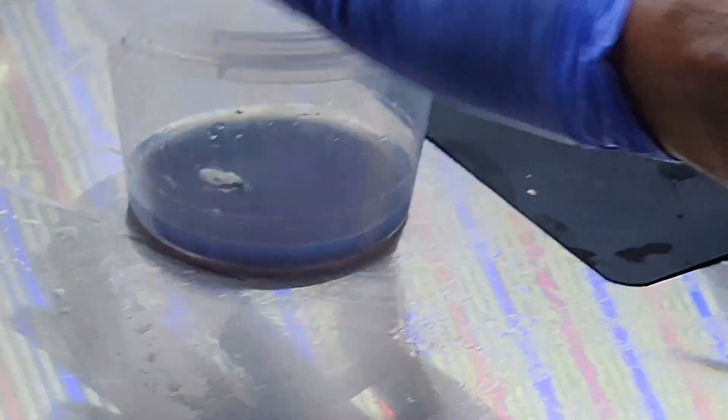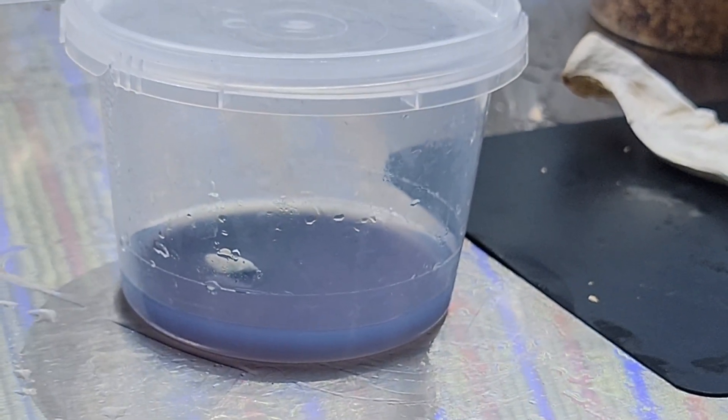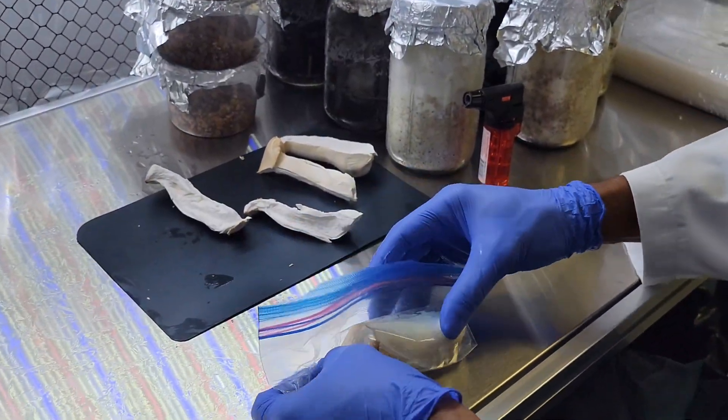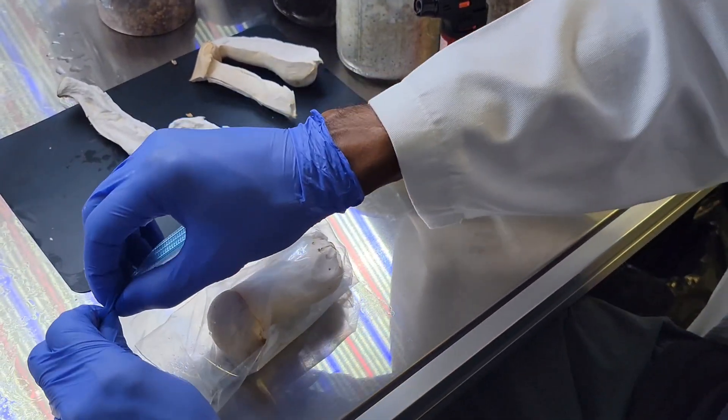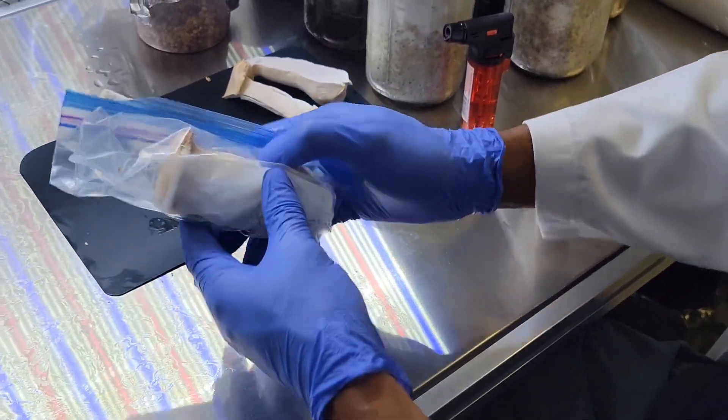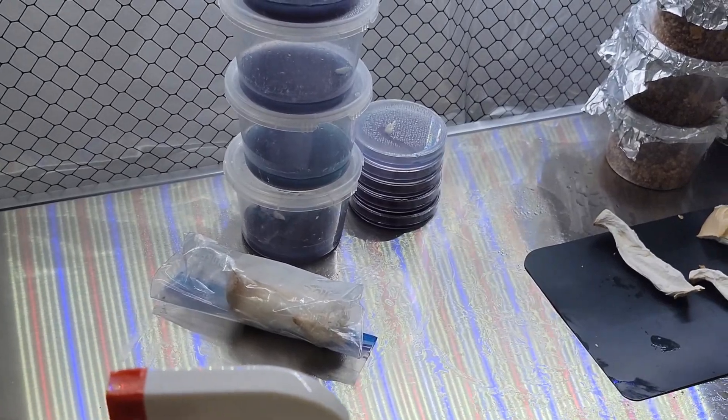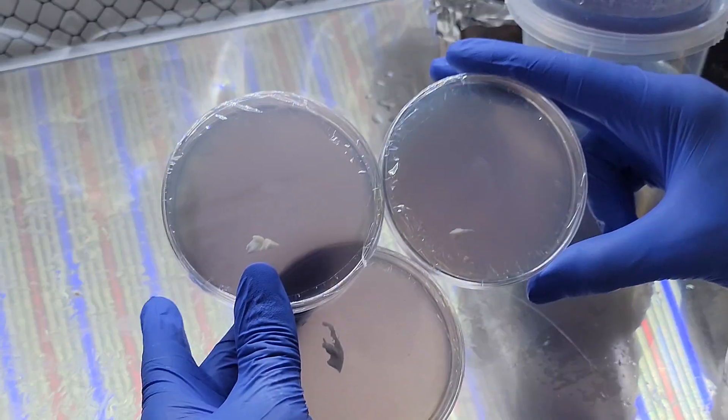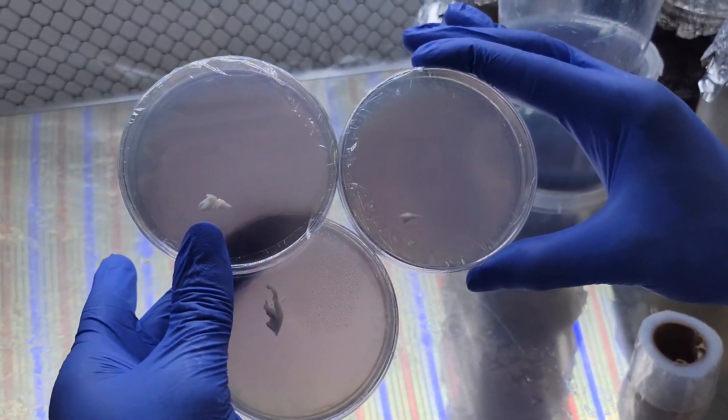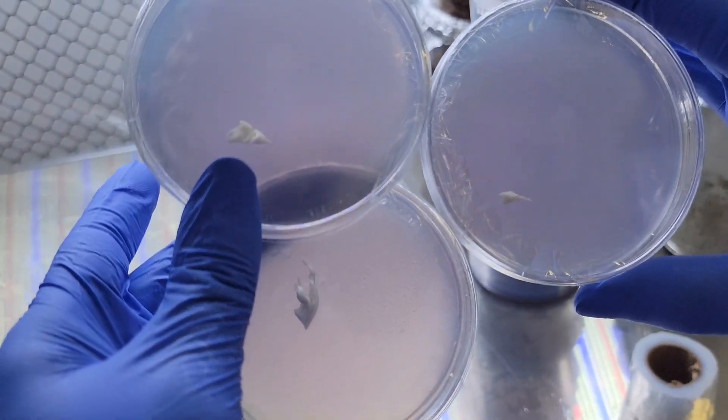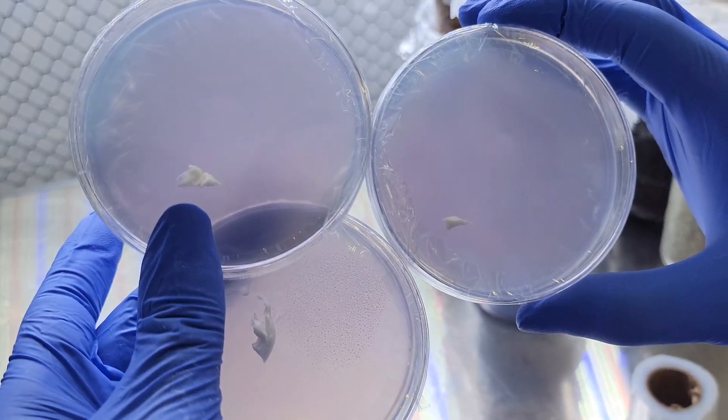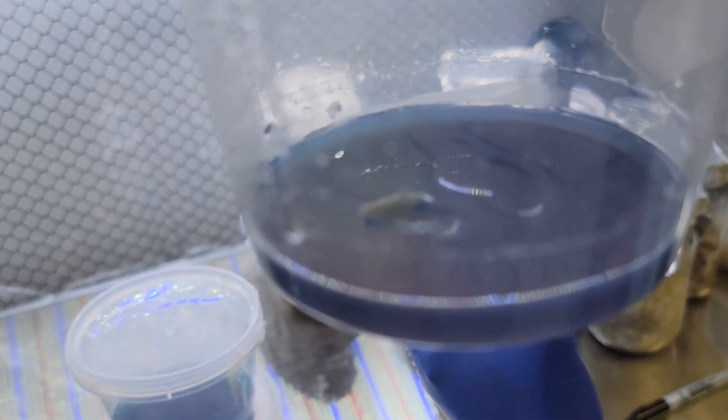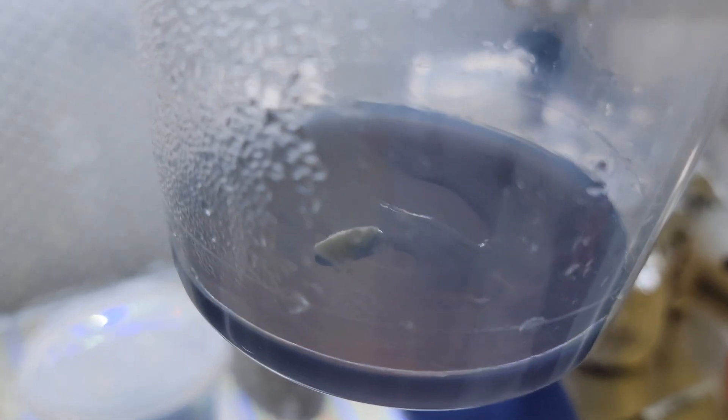We're going to take some full mushrooms and put them on the plate, see what that looks like. And fun fact: not all mycelium grow white or stay white. Some, such as shiitake, they turn brown after a while. Others may even turn red, like Pycnoporus. Also, if you happen to have any condensation or water in your cups or your agar dishes, it's totally fine. It's not really going to make a difference. Just make sure that your initial inoculation point is well established and you should be good to go.